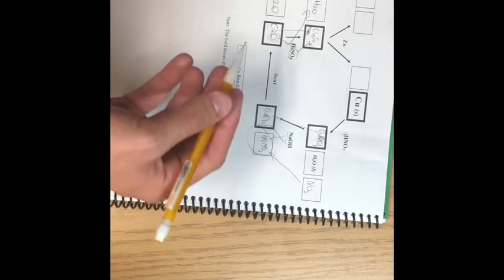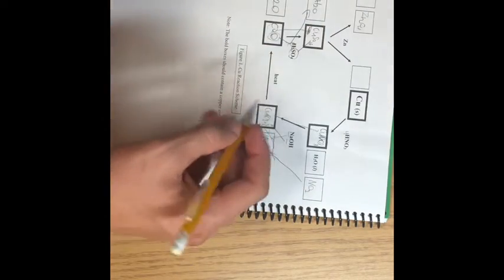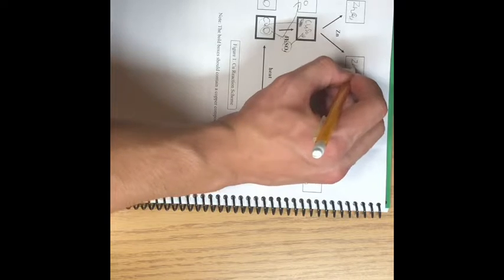Zinc sulfate is colorless, so we cannot tell using the eye that it is present, but by our calculations from the equation we can tell. So zinc sulfate goes there. See, because the copper goes here, and then the zinc comes with the sulfate to go there. And there's also some over here still. The zinc sulfate was then decanted from the water, or decanted from the red copper, excuse me.